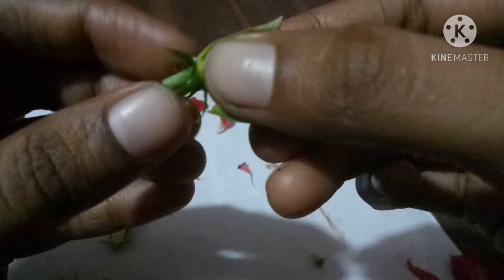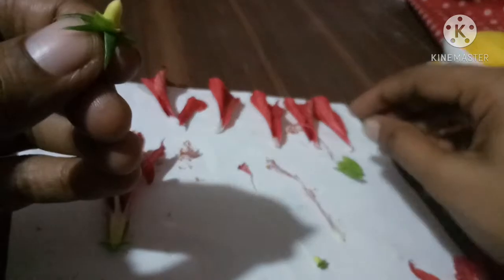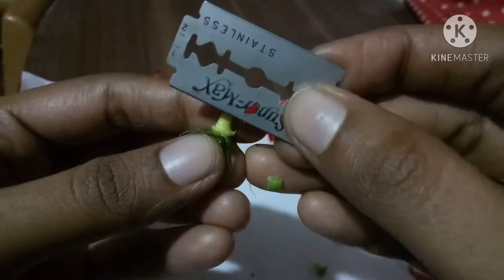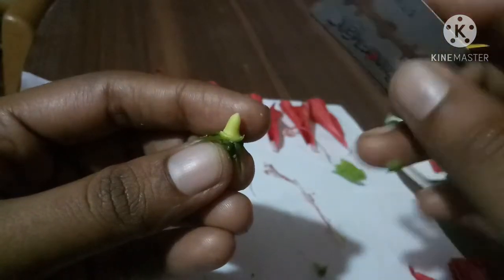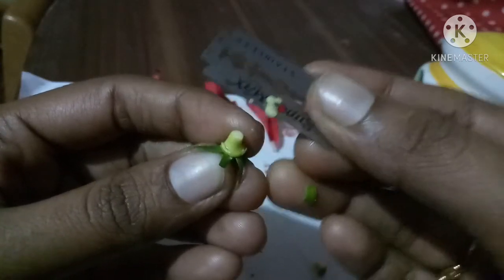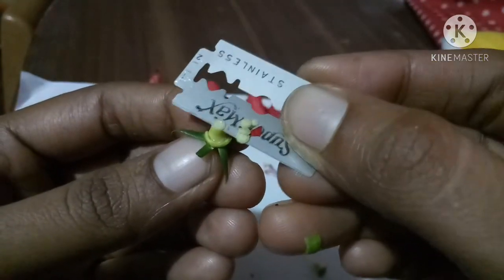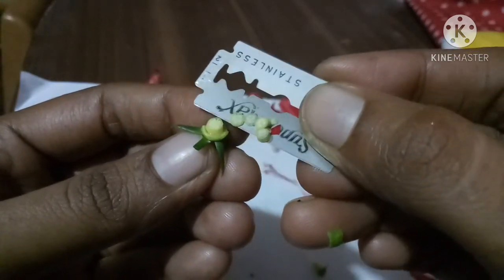Take the basal portion called the ovary and take the CS. Use a blade. Let's take the CS. This is LS and this is CS. So now we take the cross section of this ovary. Take this small cross section. You can observe it using a hand lens or a microscope. We can see the ovary and ovules.